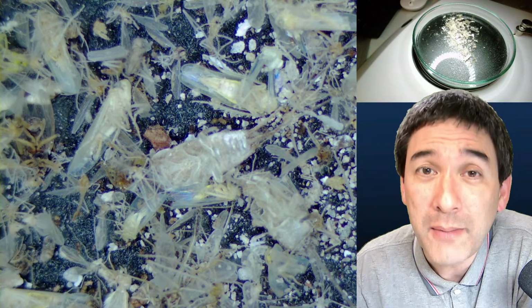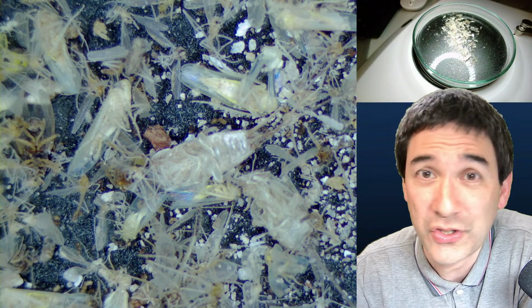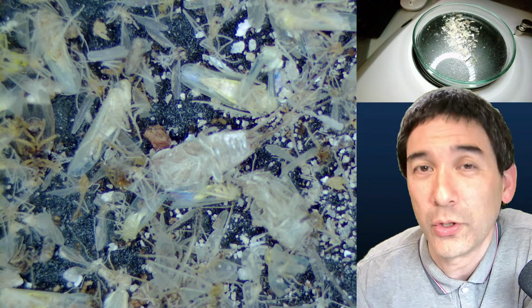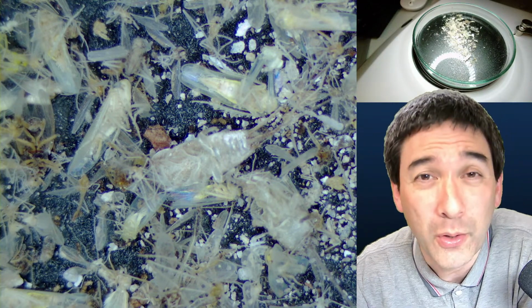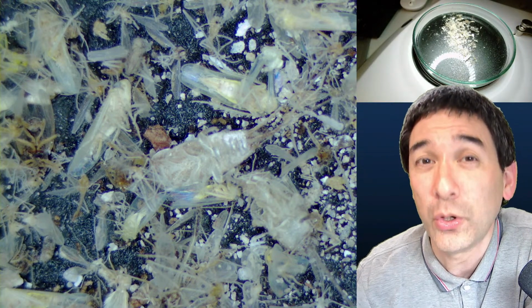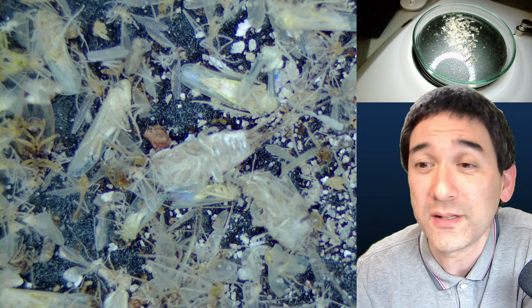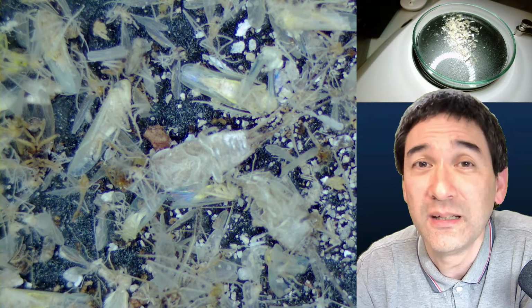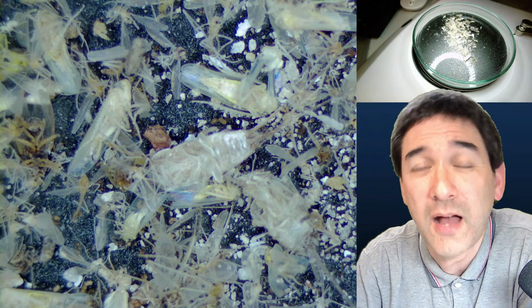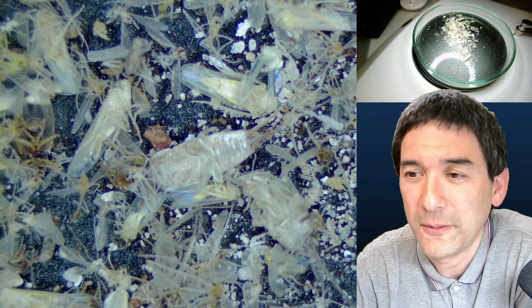Many microscopes in the range of, let's say, about 300 euros, dollars, to, let's say, $1,000 cannot be really upgraded so much. There are no spare parts or a very limited number of spare parts available and so on. And if you want to have a modular device, then you have to go to some of the more expensive companies. But I wouldn't say there's a right or wrong way, really. I would avoid toy microscopes, however, the very low cost ones.